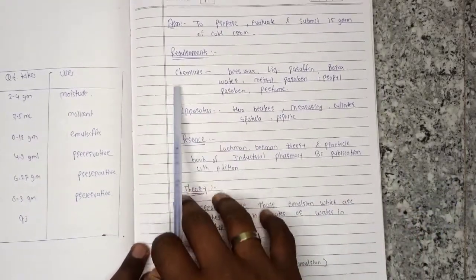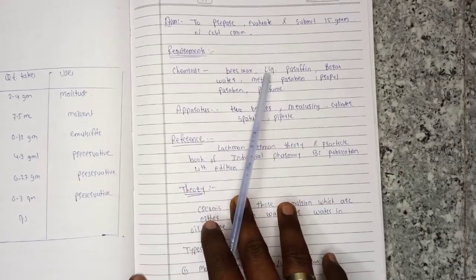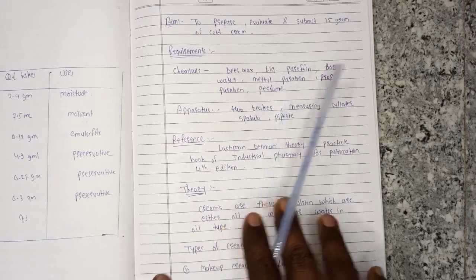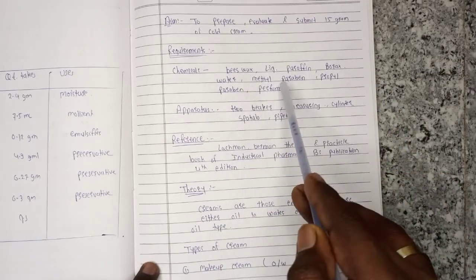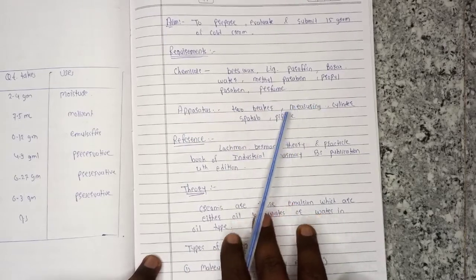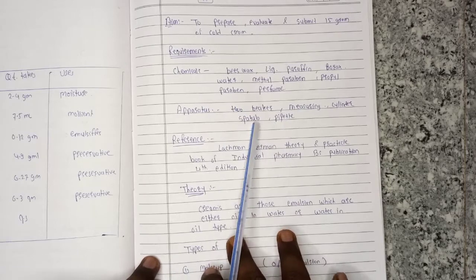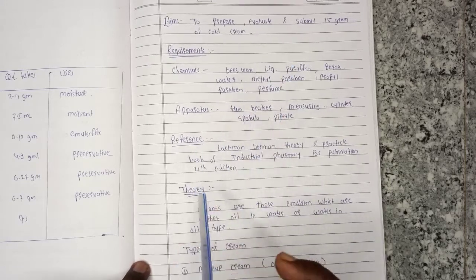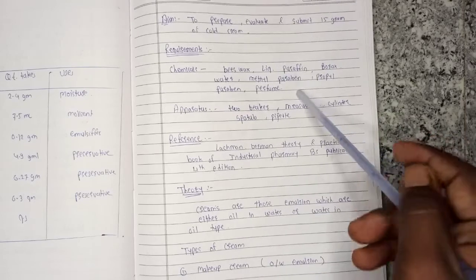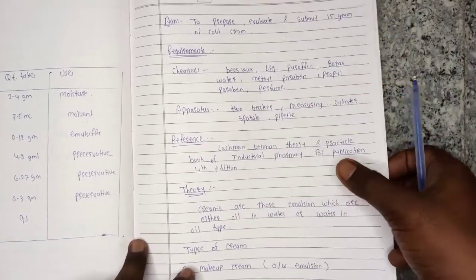In the requirements, we will take the chemicals. First of all, we will take beeswax, liquid paraffin, borax, water, methylparaben, propylparaben, and perfume. For apparatus, we will take two beakers, measuring cylinder, spatula, and pipette. We will also see how much quantity to take and what is the use of each chemical in the formula table.